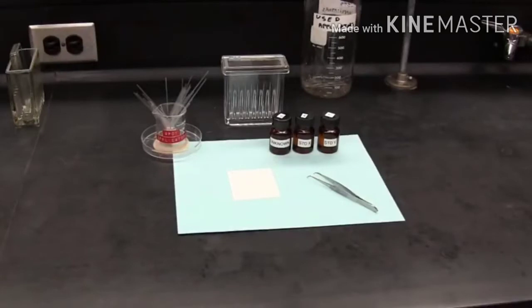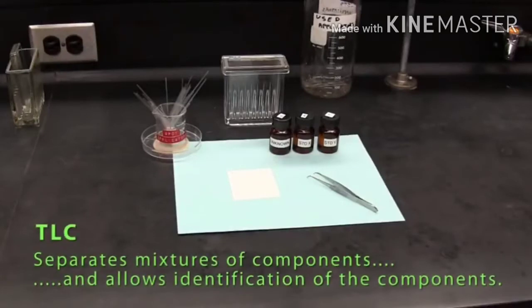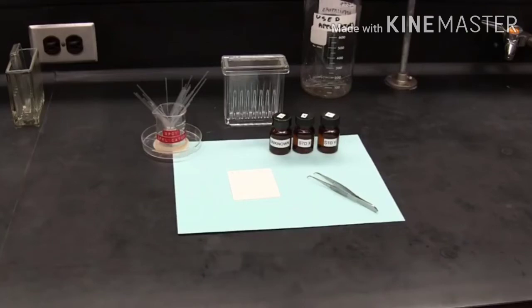Thin layer chromatography, TLC, is a method used for rapid qualitative analysis, where components in a mixture can be separated and identified. This video is focused on the general method or procedures used in TLC. For information on the theory, you can check out your lab manual or lab guide.